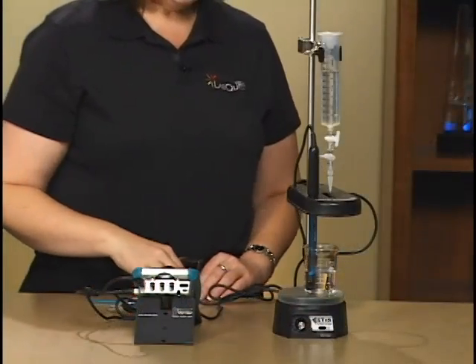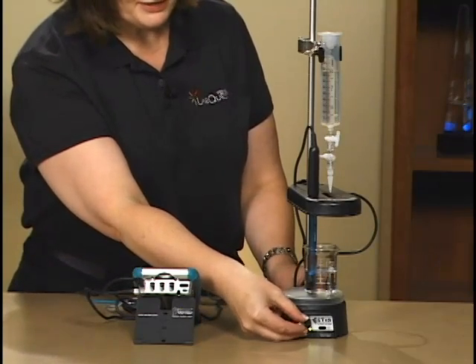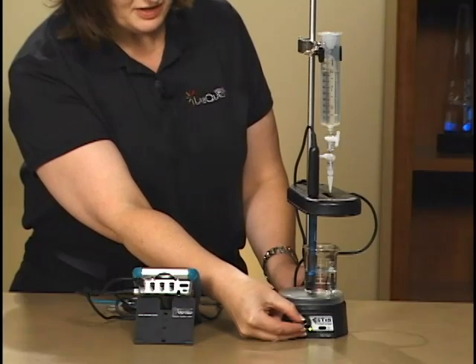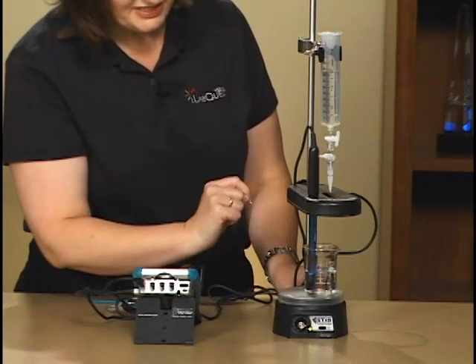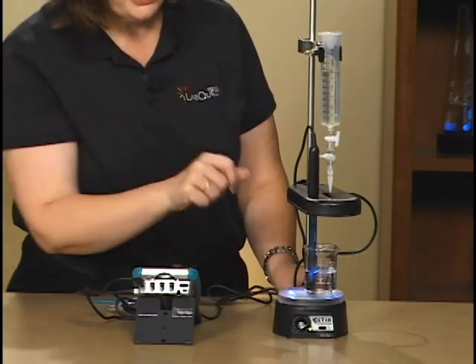We're using a few pieces of equipment to do this titration. The stir station here where we're going to have our micro stir turning on the bottom of our pH sensor which is next. I'm also going to turn on the light on the stir station so you can see that a little better.